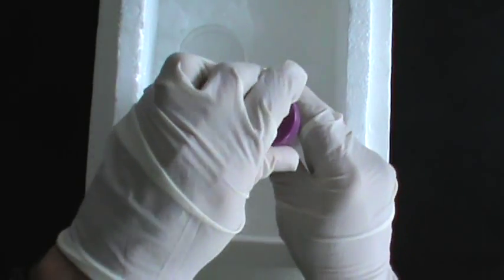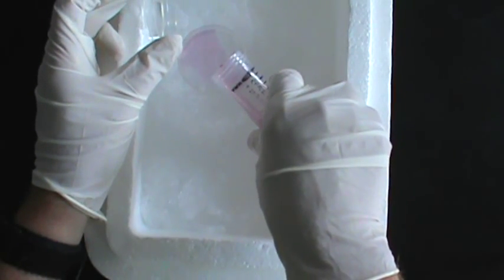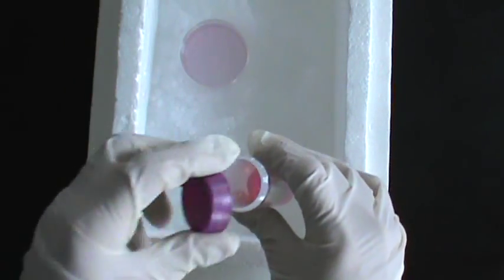Pour a small quantity of culture medium into a small petri dish. It's important that everything be kept cold throughout this procedure. Now, harvesting the spleen.